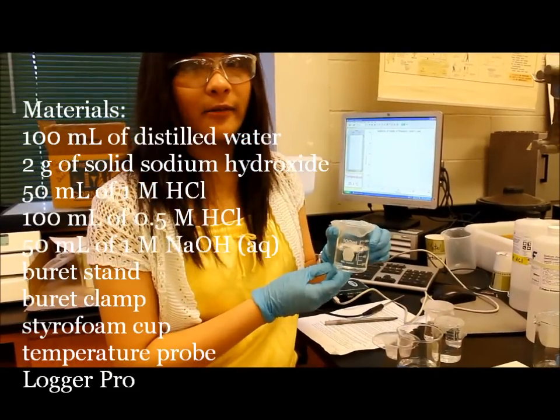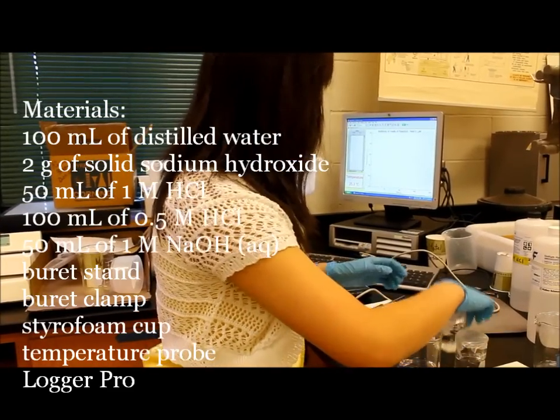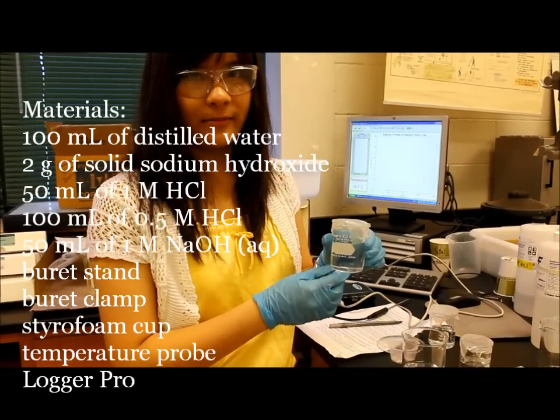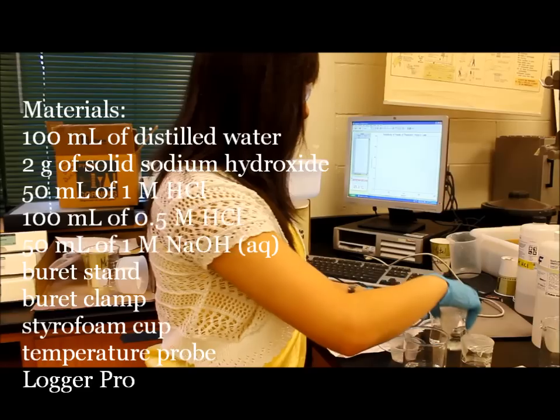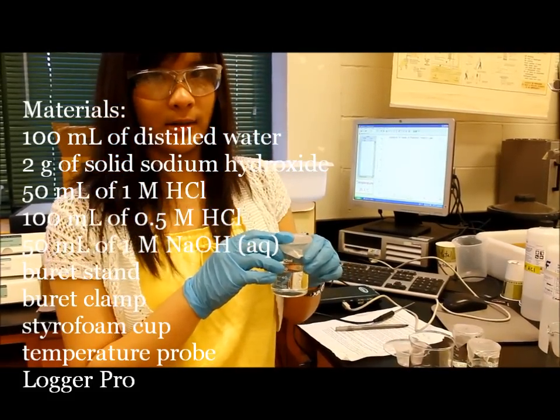50 milliliters of 1 molar hydrochloric acid, 100 milliliters of 0.5 molar hydrochloric acid, and 50 milliliters of 1 molar sodium hydroxide.